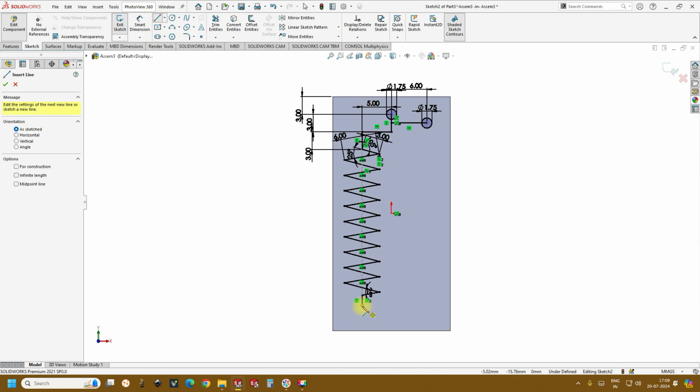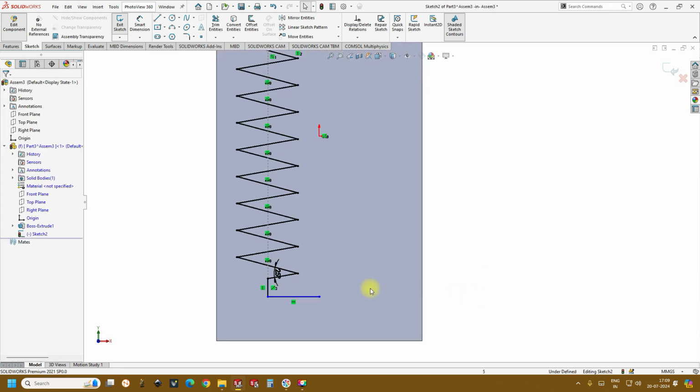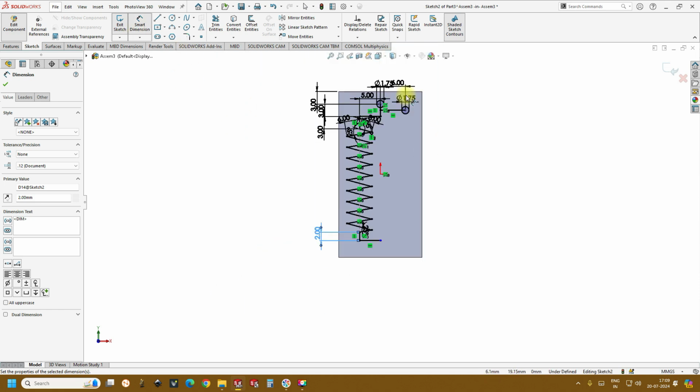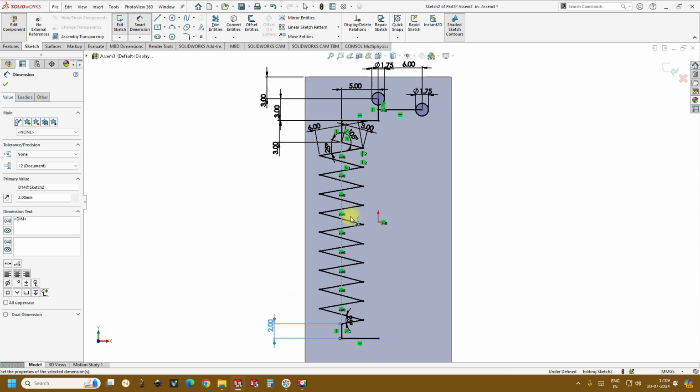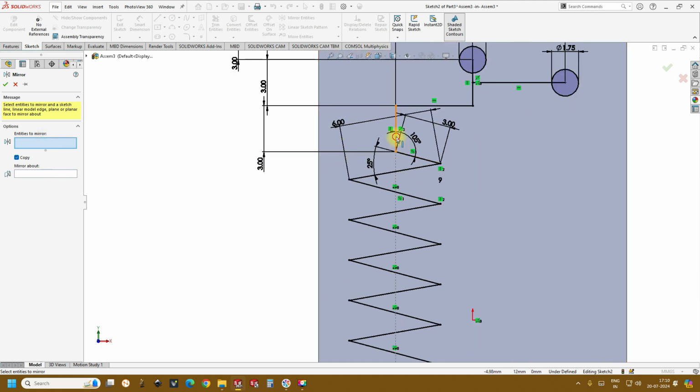So let's say if you wanted to create an outlet, and it's 2 mm, okay, and then since this should be 2 times split, we just go to create a mirror entity and then select the entities to mirror. So we need this line, also this line, also this. So all these are required for us.